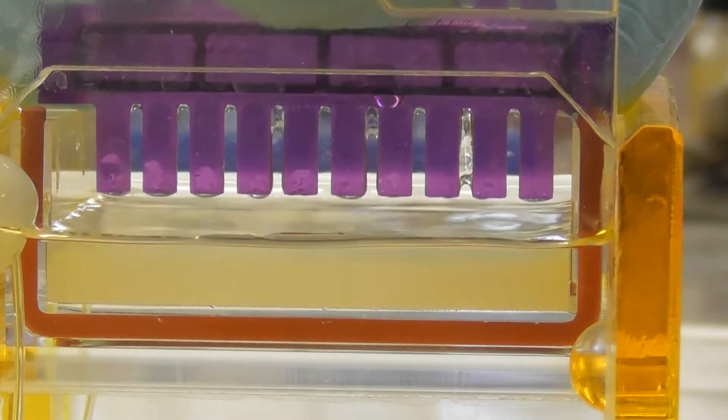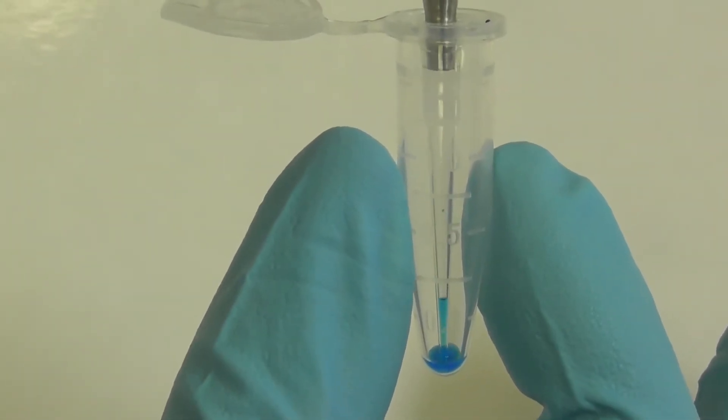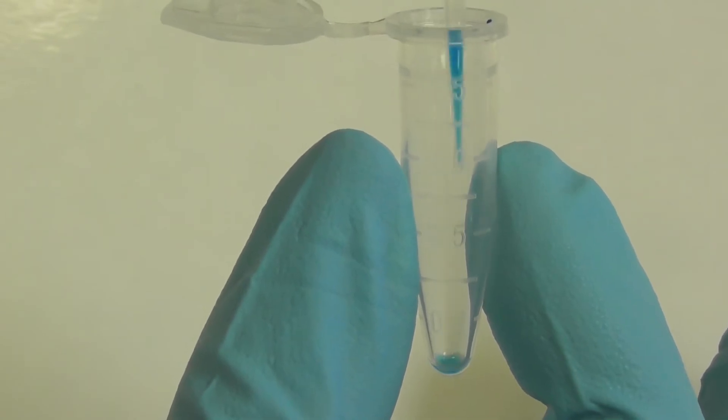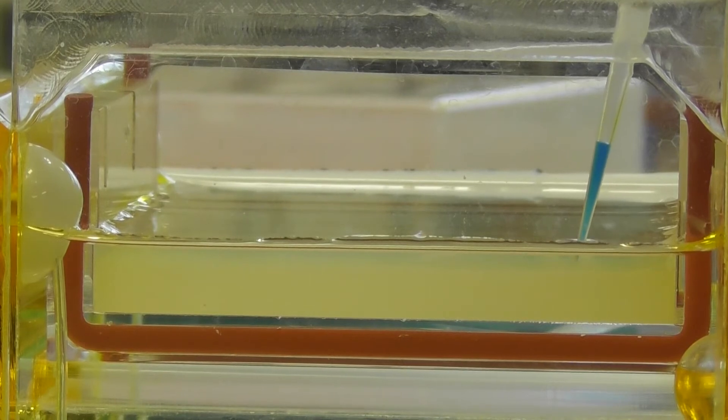Samples are prepared in small volumes with appropriate loading dye. Slowly withdraw the sample using the appropriate pipette, and then slowly dispense the sample into the well.